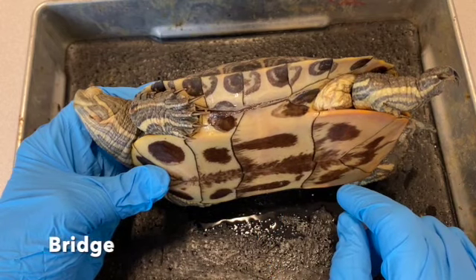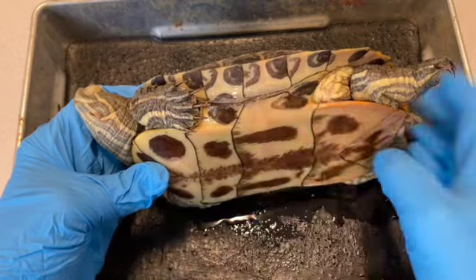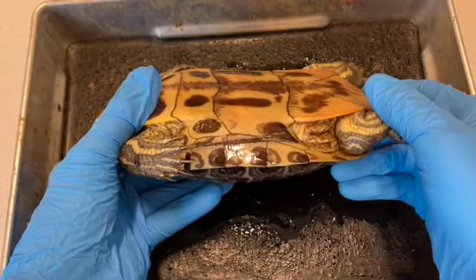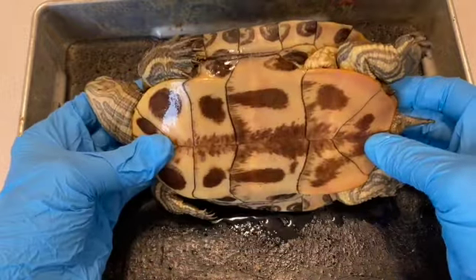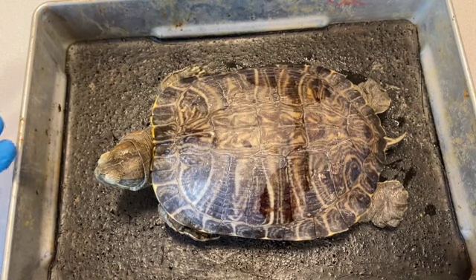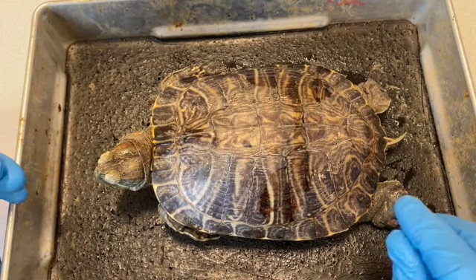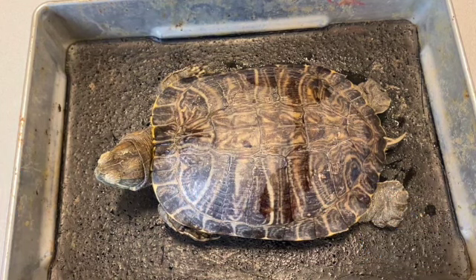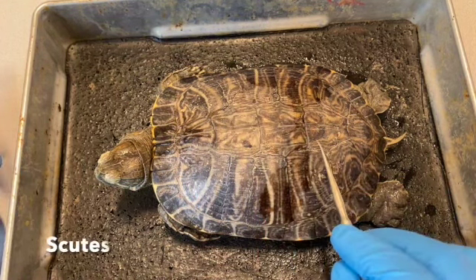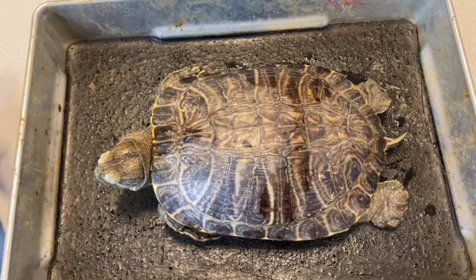And in specimens that you acquire from a supply company, they're generally cut here and on the other side here, so that when you're ready to look at the internal anatomy, access is a lot easier. Now the shell, interestingly, has a bony inner structure and a keratinized outer structure. The outer surface is covered by these plate-like structures called scutes. And each scute actually has a name and a number.